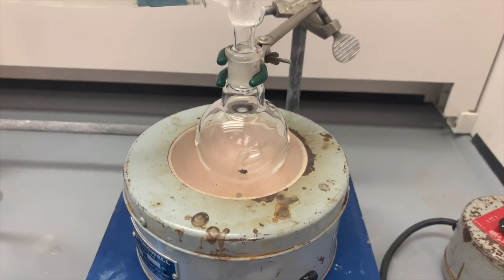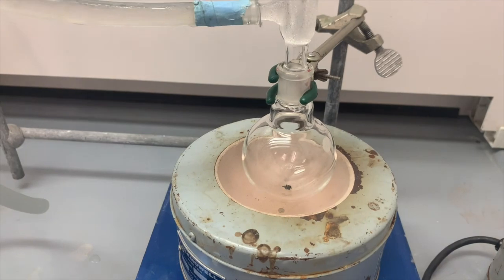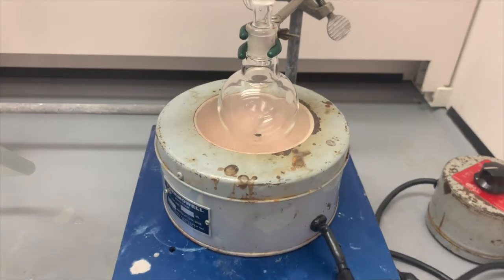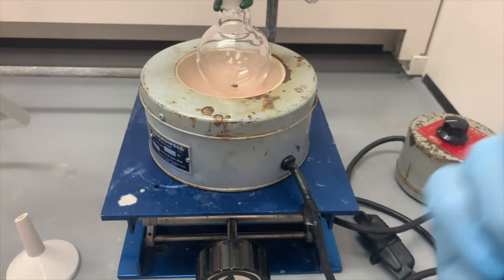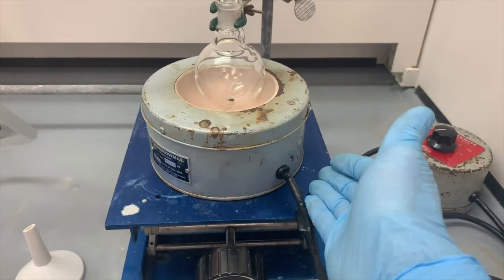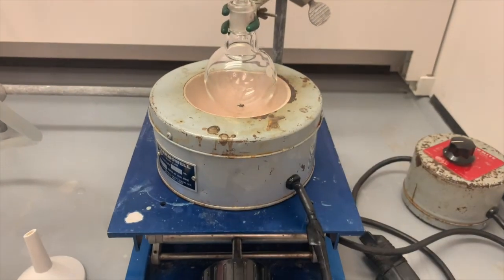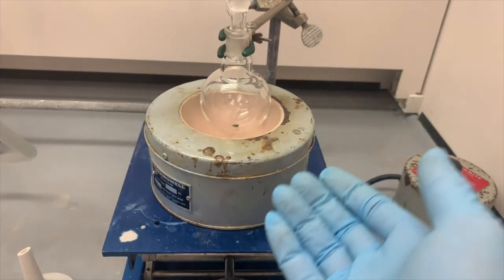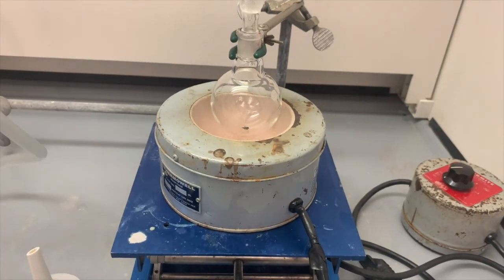Down at the bottom of the flask, we have a couple boiling chips. That's just going to allow the solvent to bubble. Normally, we would put a magnetic stir bar in there, and then below the thermowell, we would have a magnetic stirring plate. But sometimes we don't get enough magnetism to flow through the thermowell, and it doesn't stir effectively. So we're using the boiling chips because as this material boils, that will create enough mixing to allow this reaction to take place.